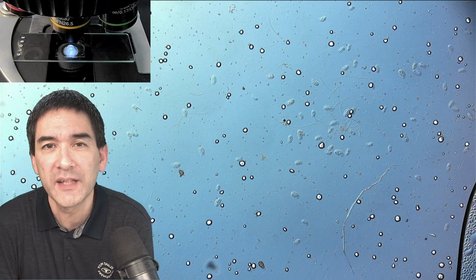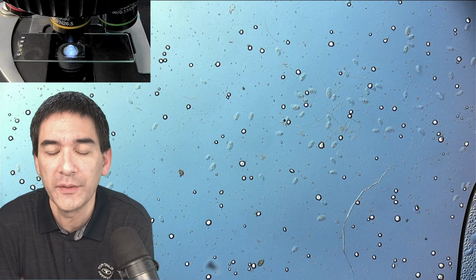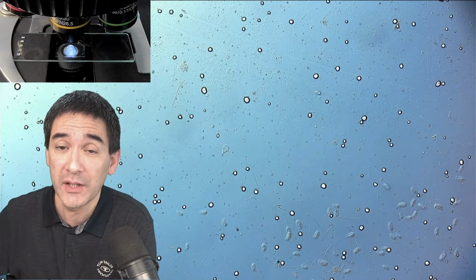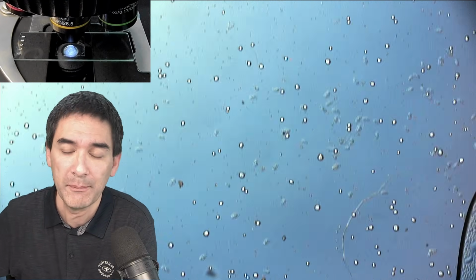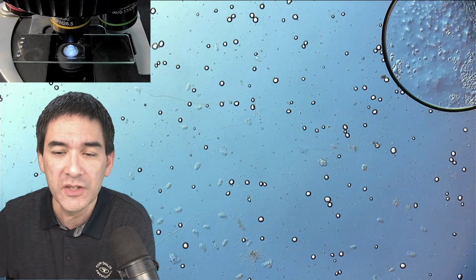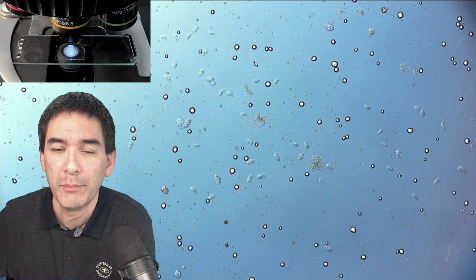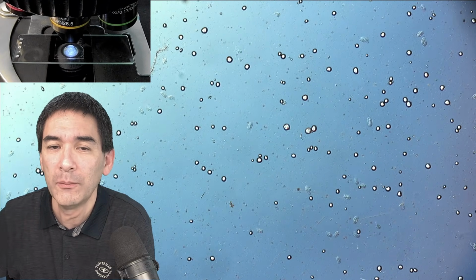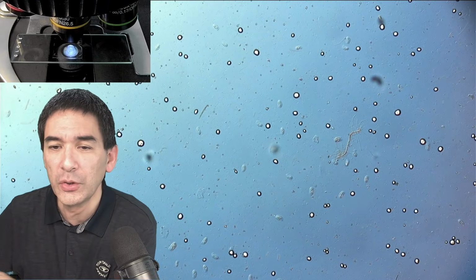And something that you're not able to see quite well are the tiny bacteria that are also floating around in there. As a matter of fact, this sample isn't even that bad, because I've already pulled samples from the jar where there were so many starch grains that it was almost impossible to actually see anything else. So I'm going to show you now a second possibility, but I think this one is fairly good actually.